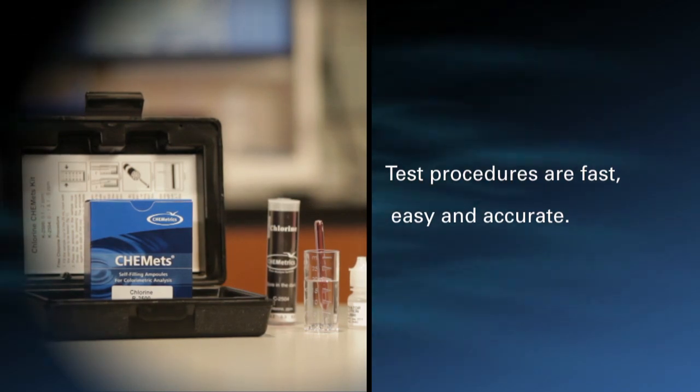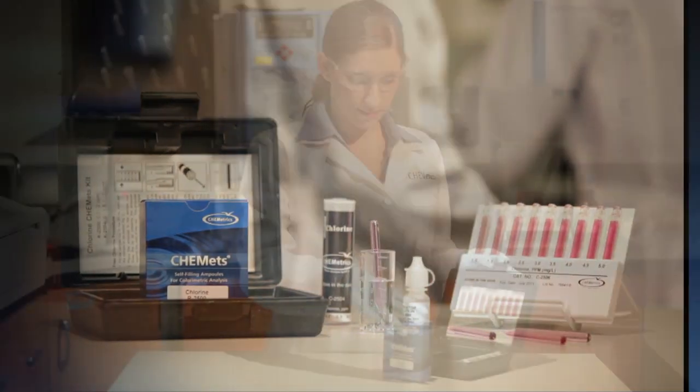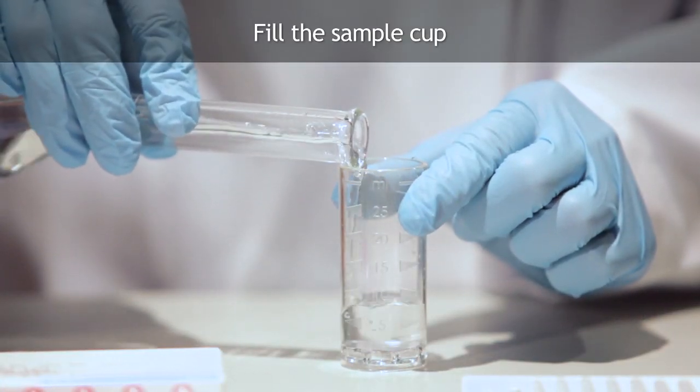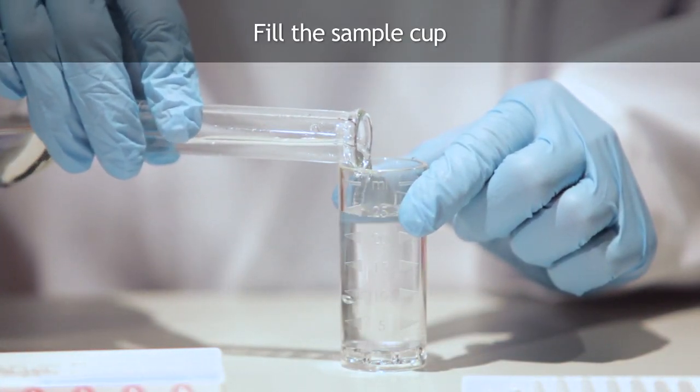Test procedures are fast, easy and accurate. To perform a test using the CHEMets test procedure, fill the sample cup to the 25ml mark with the sample to be tested.